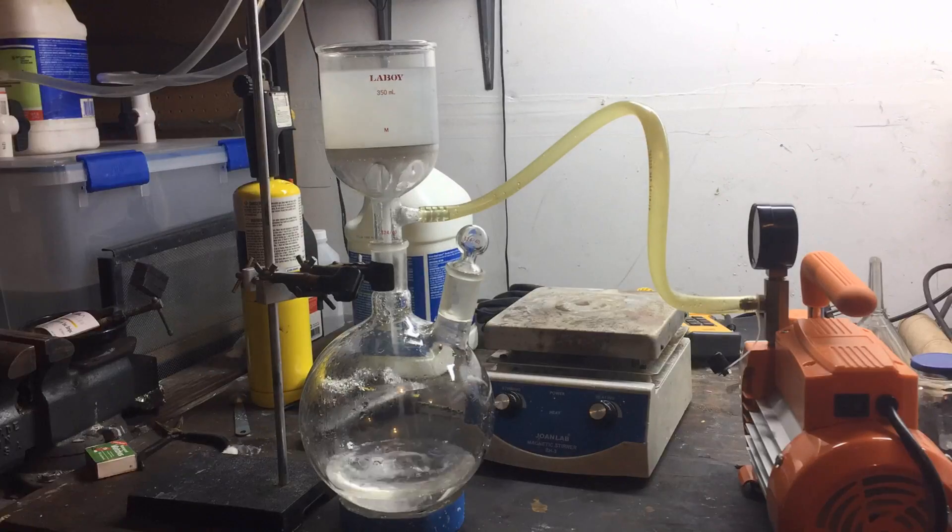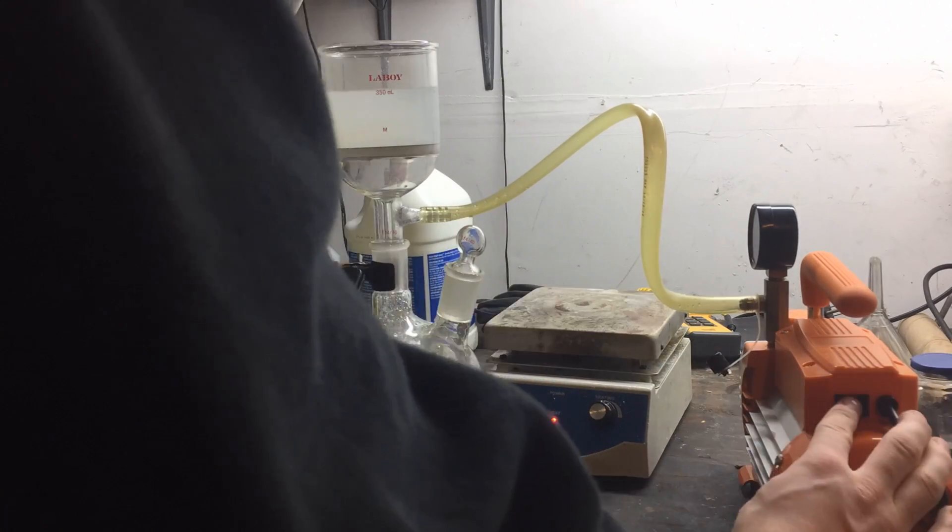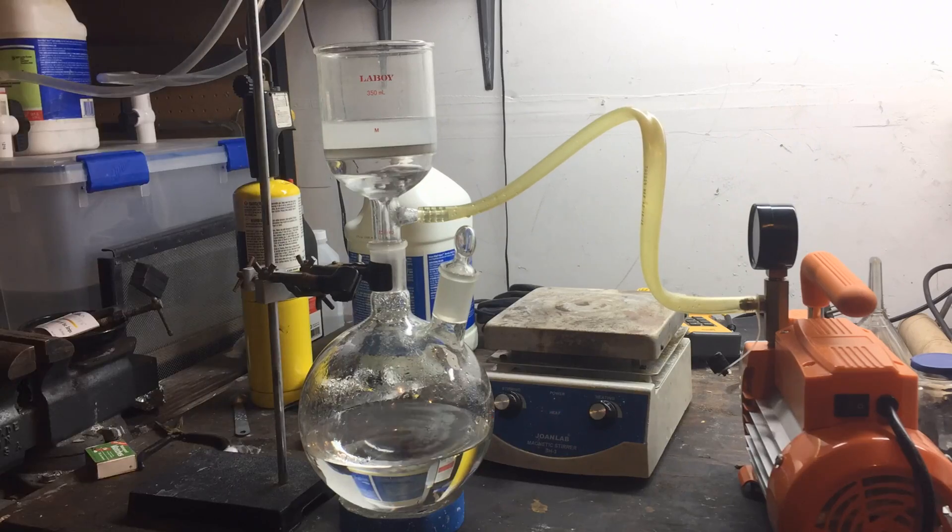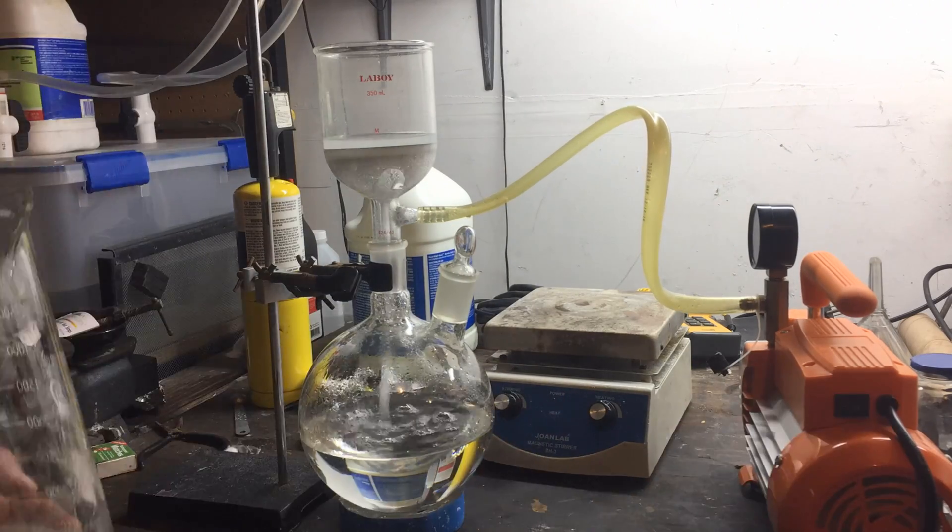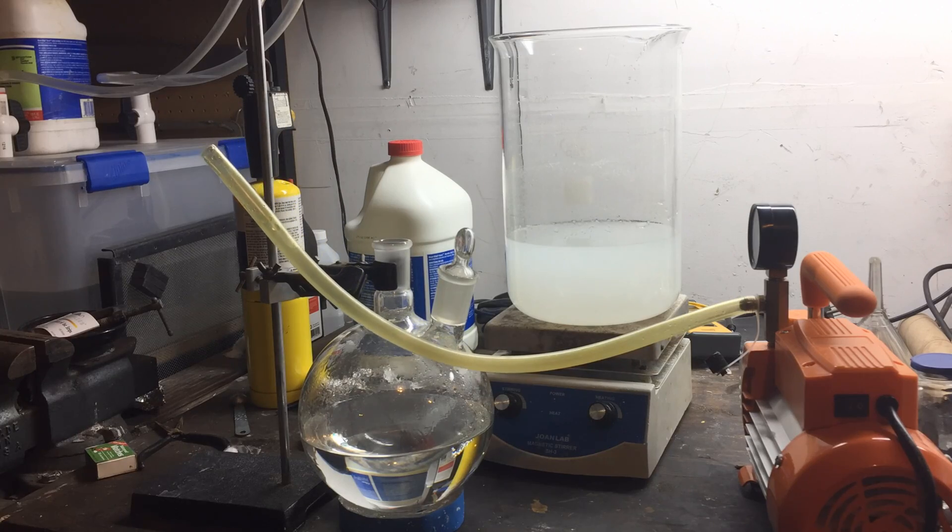Very quickly, however, I figured out that this was a particle suspension, and so I needed to remove some of these insoluble impurities. So, I started a vacuum filtration process, and in the end, I was only able to collect about a gram or so of insoluble material in the filter.